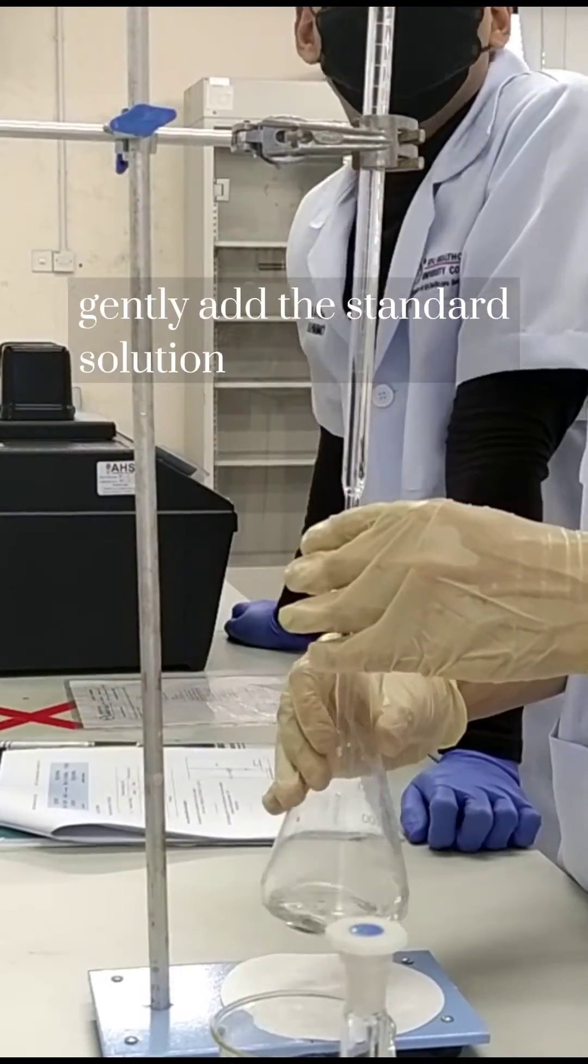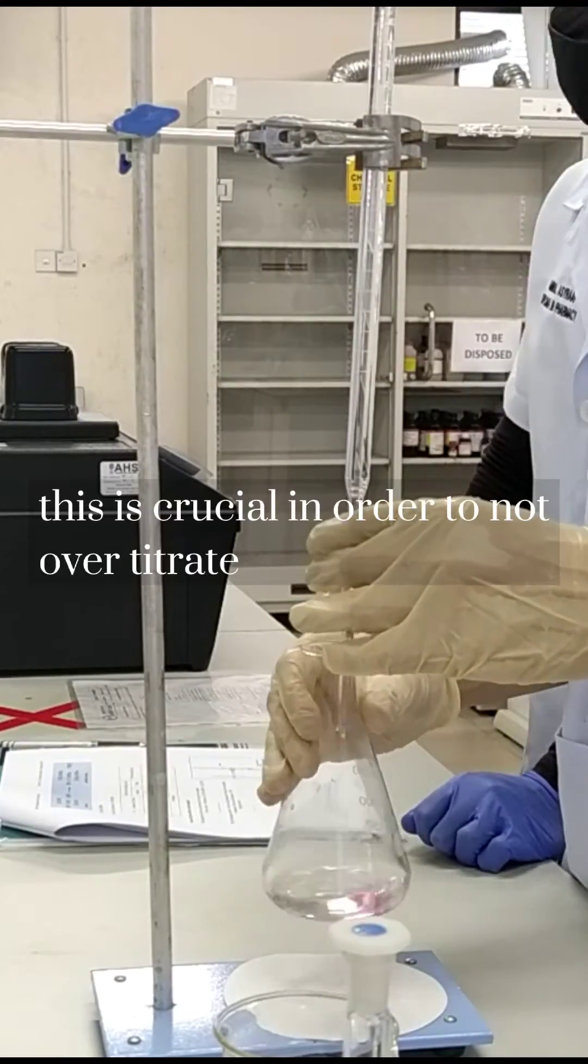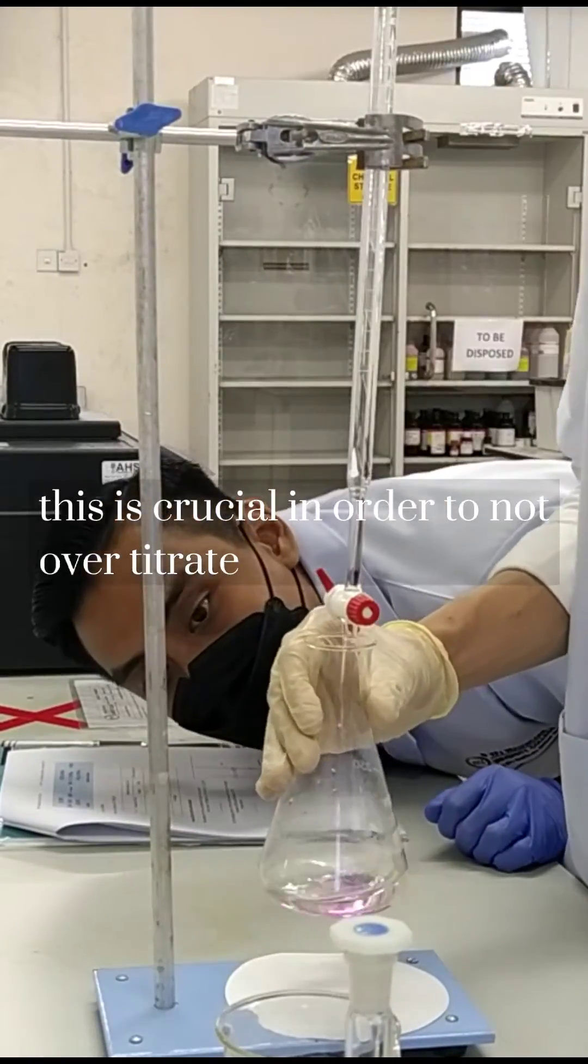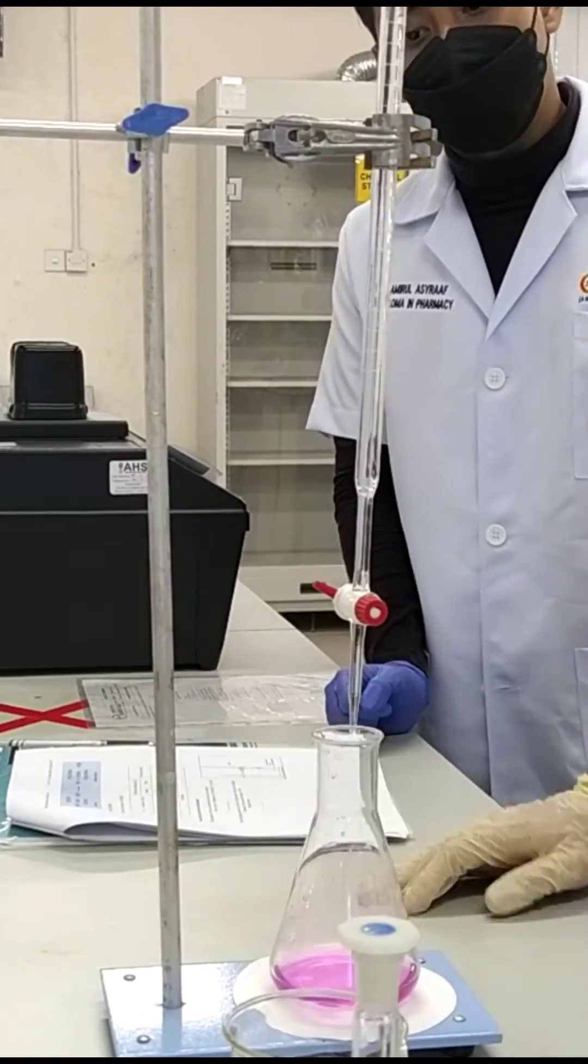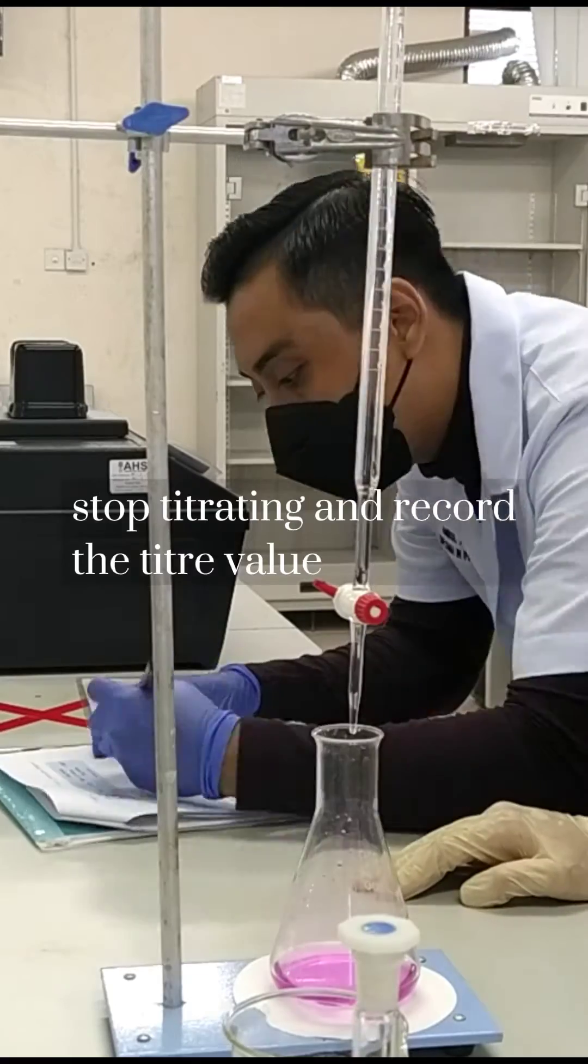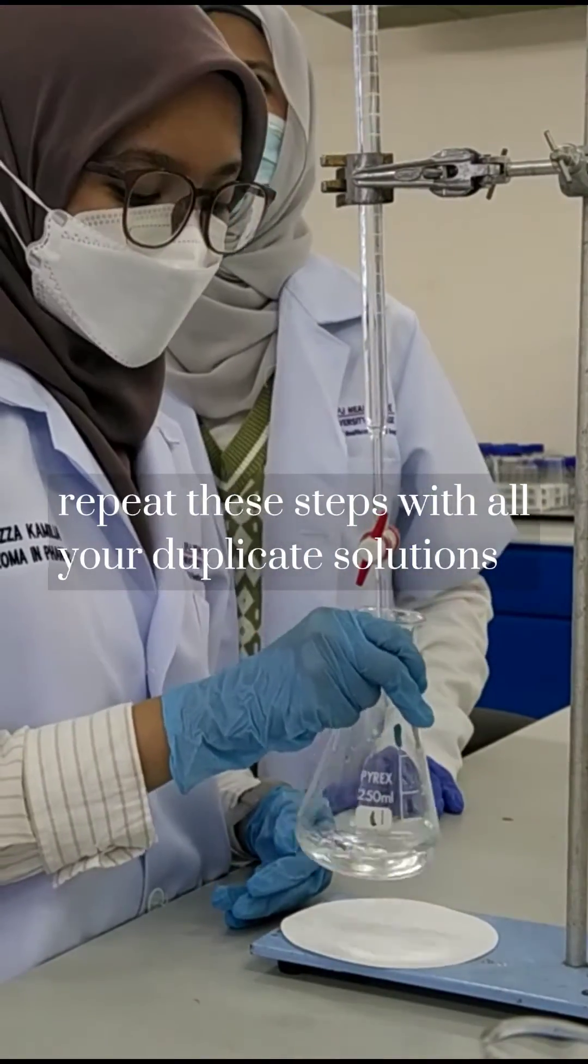Now you begin to titrate, carefully swirling as you control the burette until the color changes to light pink. Stop titrating and record the value of the standard solution.